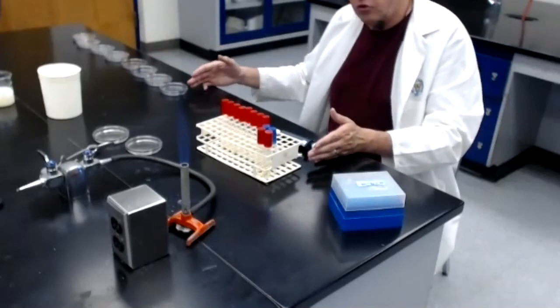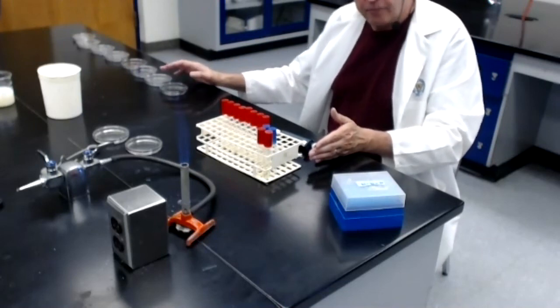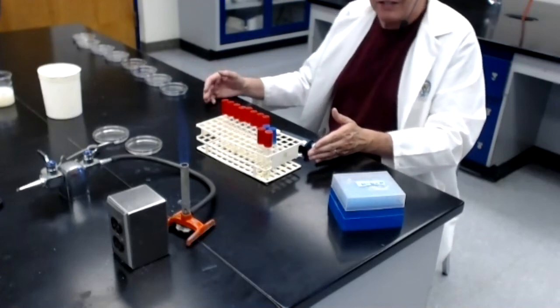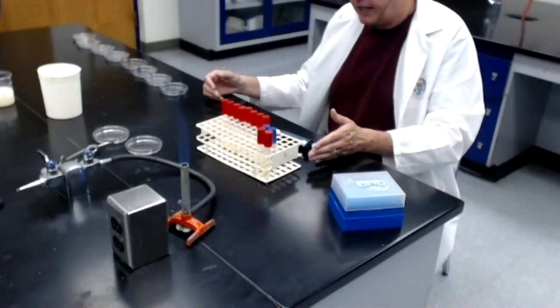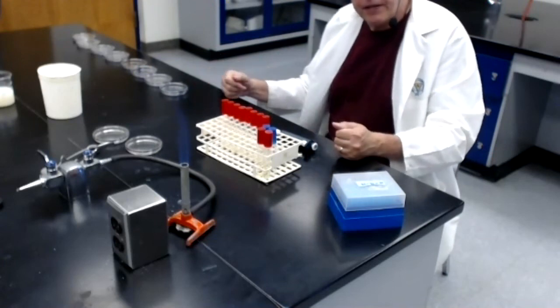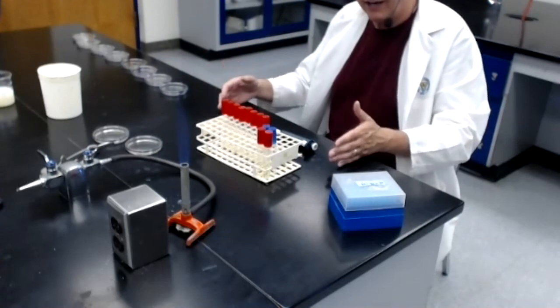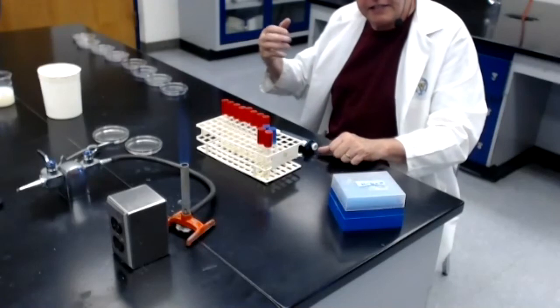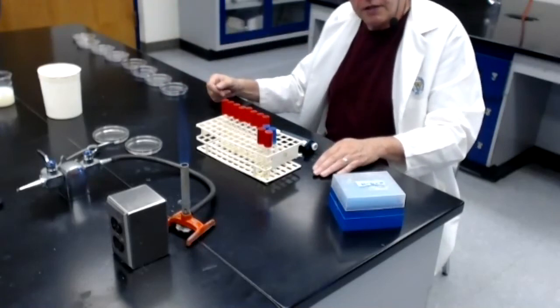You never want to do bacterial counts or plate counts on a single set of plates. You always want to have at least duplicates of each dilution and preferably triplicates, because you do get some bouncing around when you do replicates, and you need to have at least 2 plates to get an average from. So again, I didn't set it up that way for you to see. You'll just have to trust me that when I get off camera, turn everything off, I'm going to finish these plates, and then I will immediately set up another set of 10 plates to match the dilutions that we made.